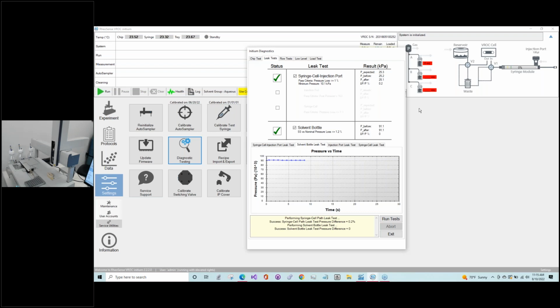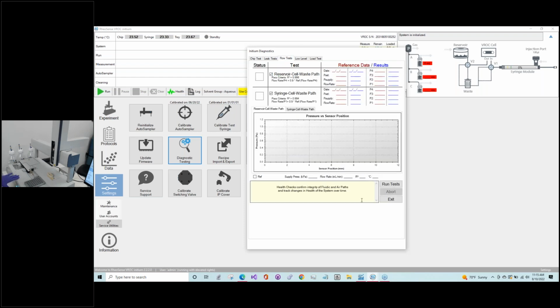Okay, so everything is good with us. We're not leaking anywhere. So the next one we're going to move to is the flow test, and we do two of these. What we're really looking for is whether there are any obstructions in the flow path. That means from the test syringe through the switch valves into the flow channel to the reservoir, and also a path that takes you to the waste.